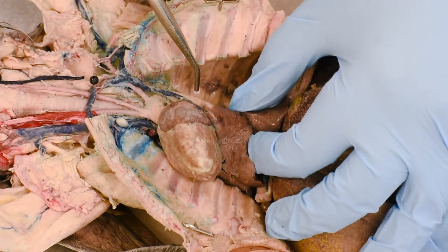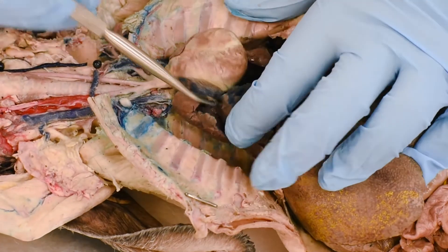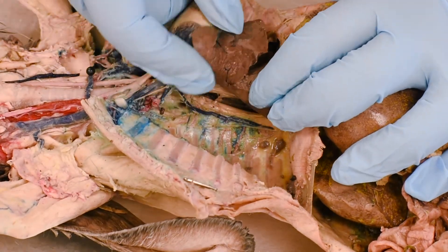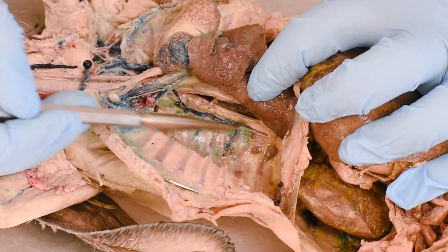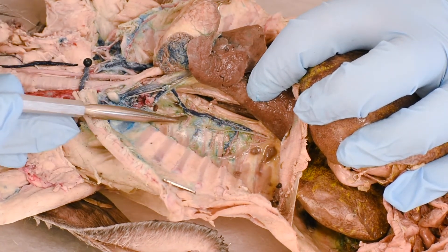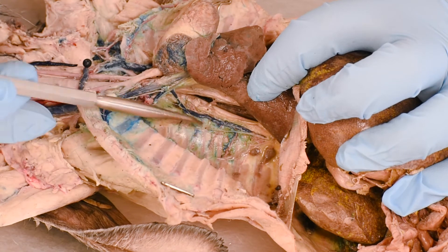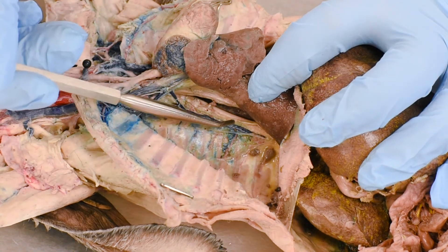Look how big it is — specifically this is called the thoracic aorta. Now if we move all of these thoracic organs to one side towards the left, we will see a very prominent vein. This is called the azygous vein. There are not two branches of this one — there is only one in the thoracic region.